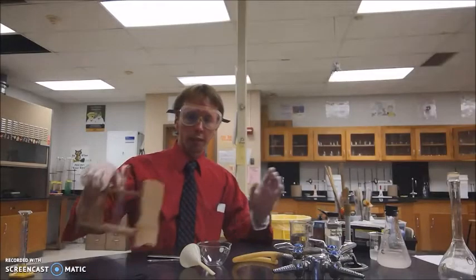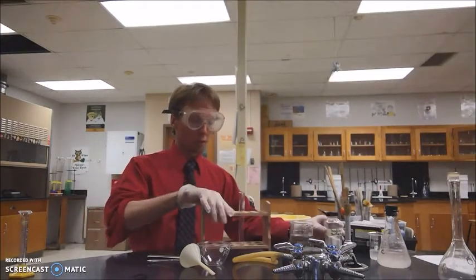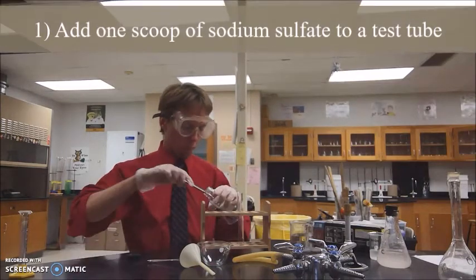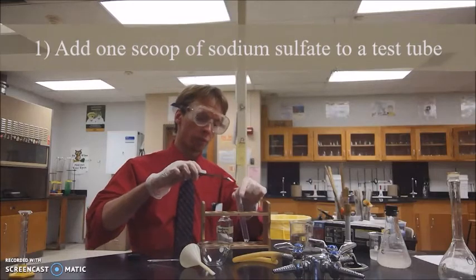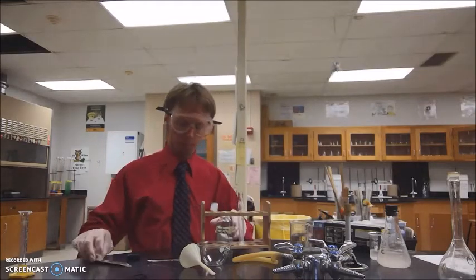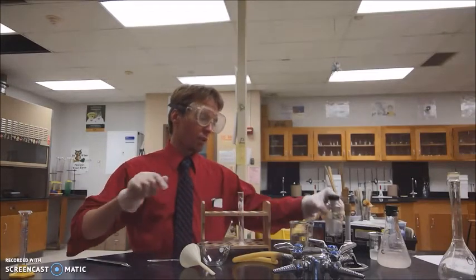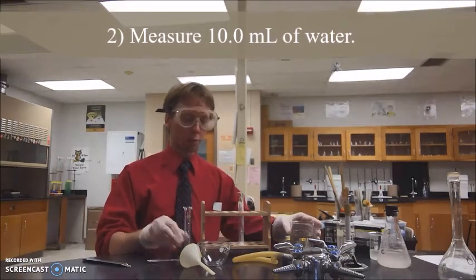And then what you'll do is you'll get a test tube and a wooden test tube rack. You're going to take your metal scoop and add 1 scoop of sodium sulfate to the test tube. And you close that up. Your next step is you're going to measure 10 milliliters of water using a graduated cylinder.